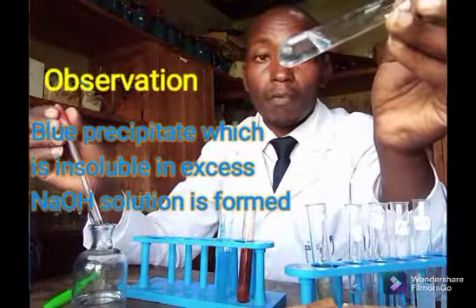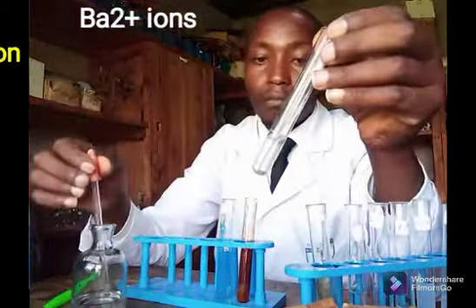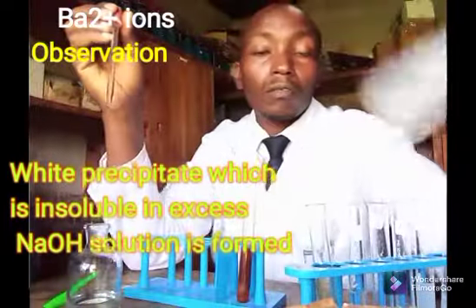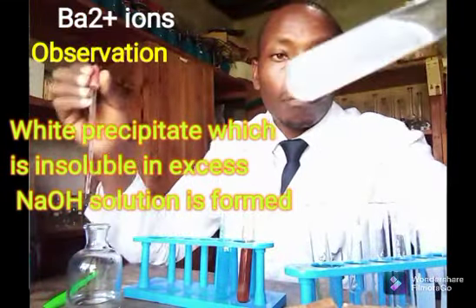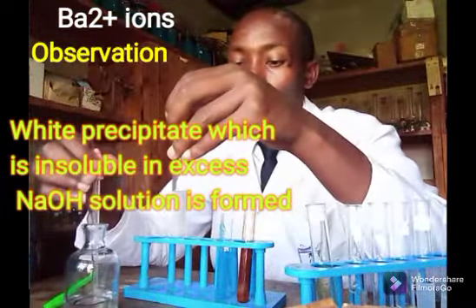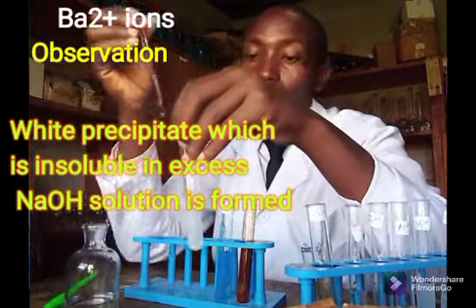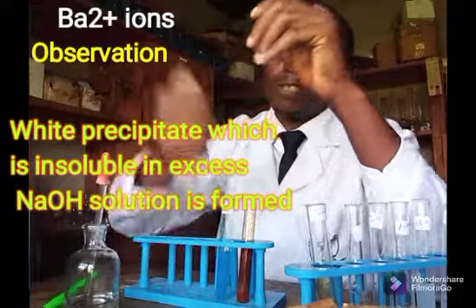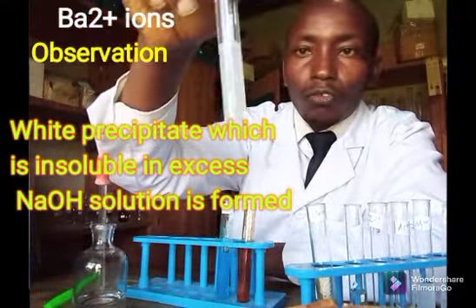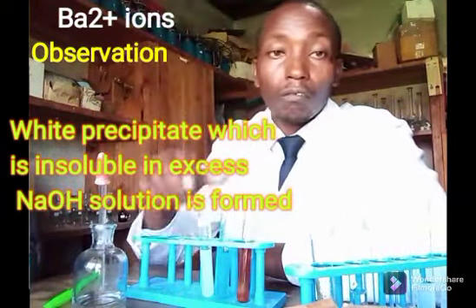Then I have another one with barium. So with barium, good, observe that one. Good, the white precipitates are there. Let me add excess of it, and I can even shake, and the precipitates are still there. Yes, I can confirm the precipitate did not dissolve.